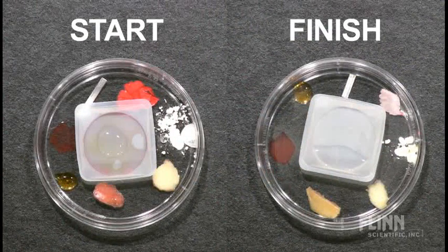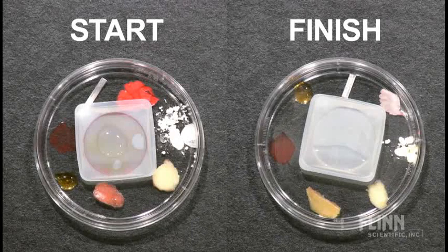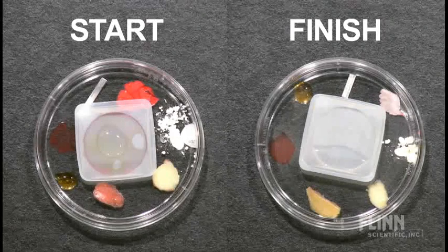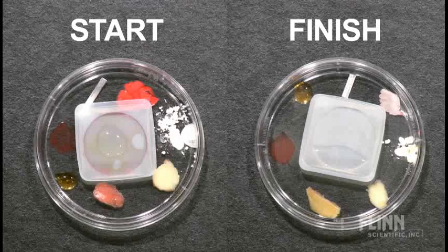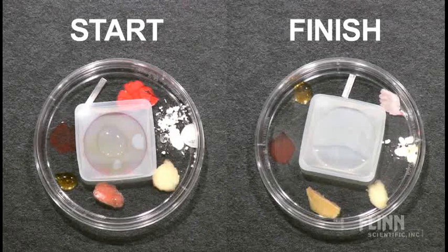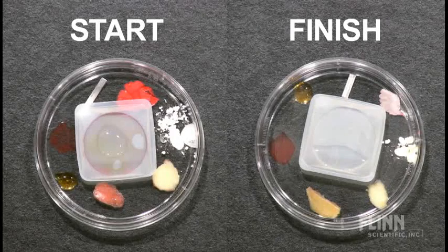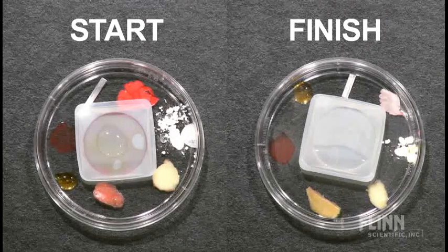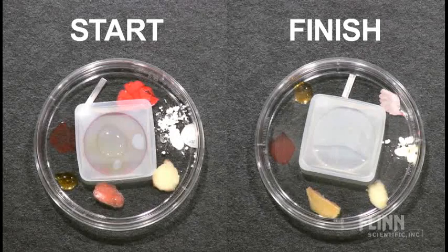What we see now is that our apple skin is no longer red — it has gone to kind of a bleached out whitish yellow color. We see that the apple flesh still looks nice and white. There is a little bit of change in the calcium carbonate; students sometimes say it looks a little crusty. The red flower petal no longer is red — it's completely washed out. The magnesium metal, if you look very closely, may be slightly pitted on the surface with a little darkening, though that's difficult to see. The bromothymol blue solution has changed to the yellow form, and our universal indicator solution has also changed into the red form.